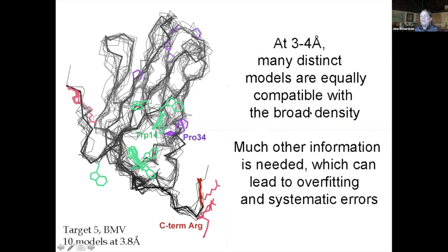And the basic thing is that at 3 to 4 angstroms, and even more so at lower resolutions than 4, the map is compatible with really significantly different models. Even in this case, one's traced backwards and with lots of sequence misalignment. And this is a particularly bad case, but you see these. There was a recent structure with a whole large section, about 80 residues, where the sequence was misaligned by 15 residues. Anyway, these problems are there a lot more often than people would like to think.